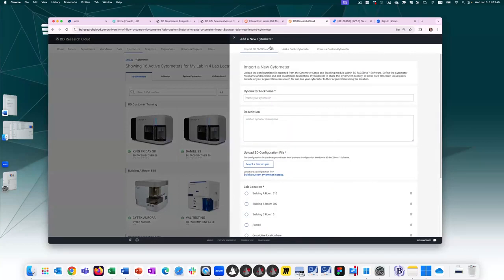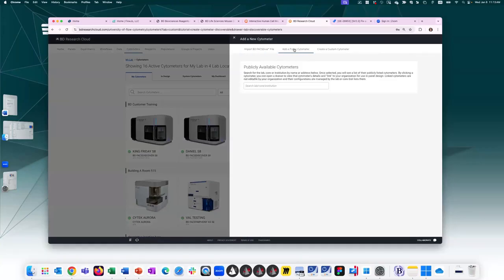If your cytometer runs FACSDIVA, we recommend you upload a FACSDIVA export configuration file. If your core lab has access to BDRC, you can look up which, so for example, the Fred Hutch, I can click on it.